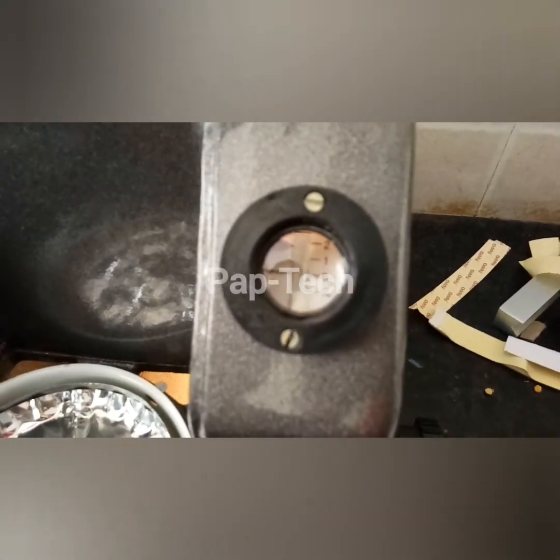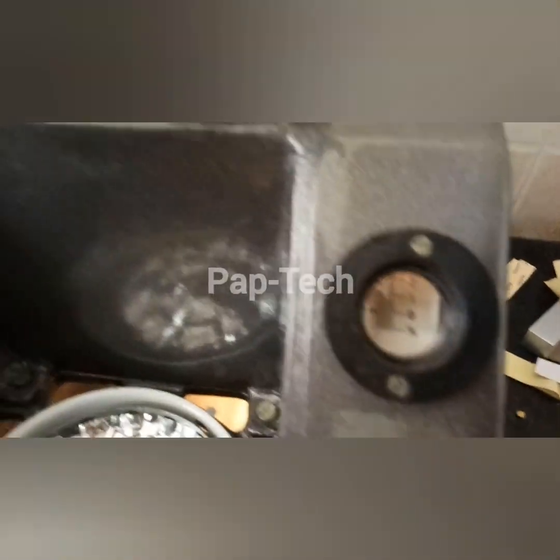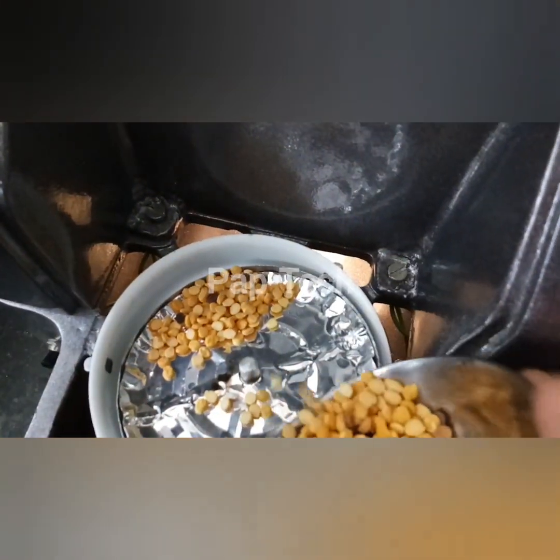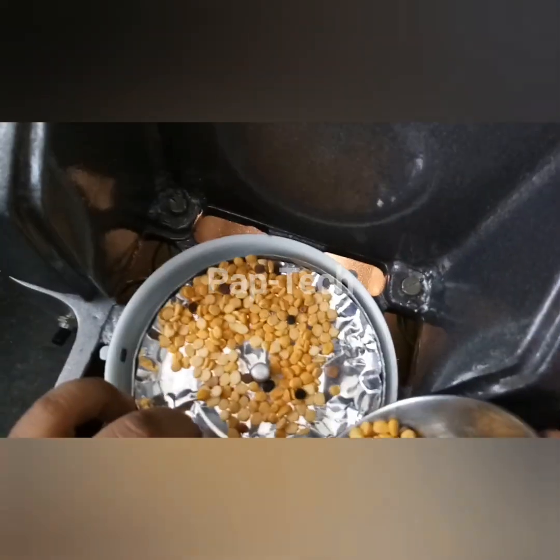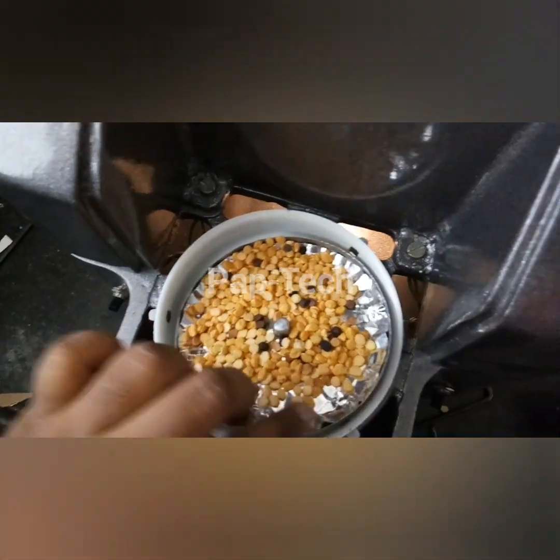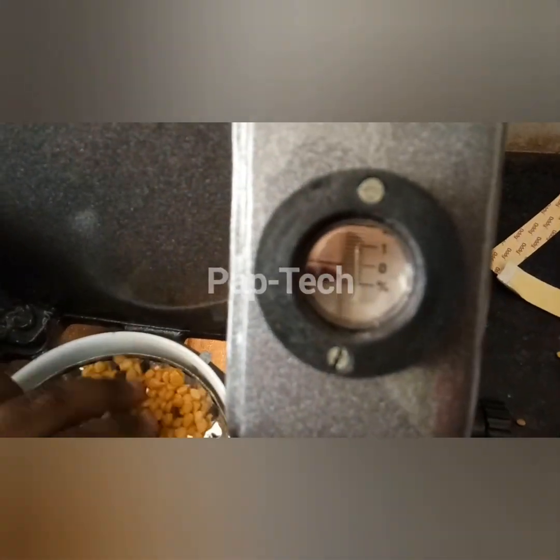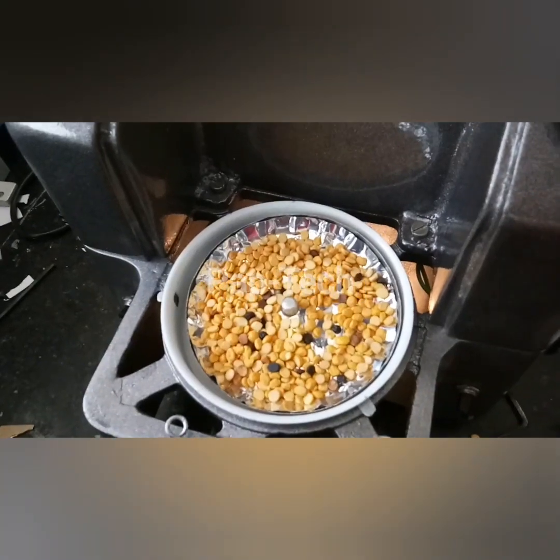Now we have to insert the pulses so that the red mark will come to zero. We have to spread the sample towards all the surface. Now the mark has come to zero and the pulses have been spread across all regions.